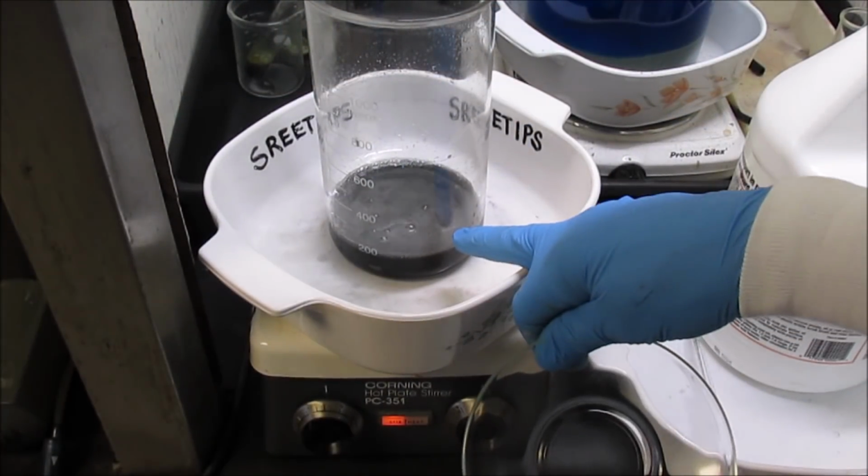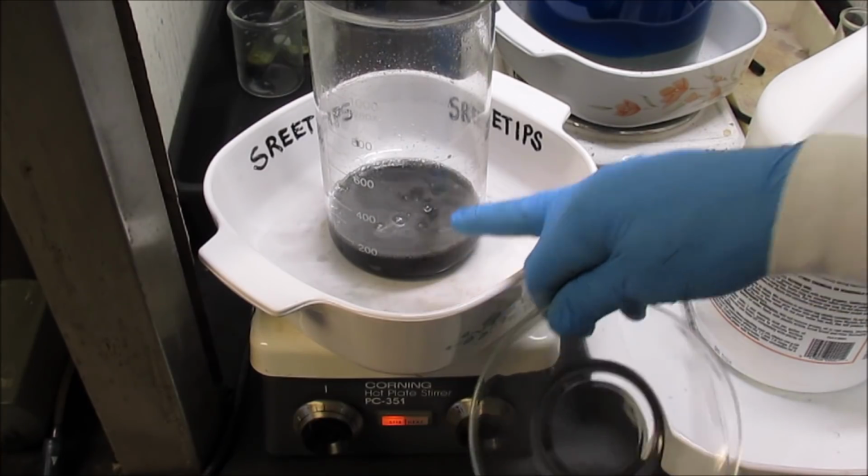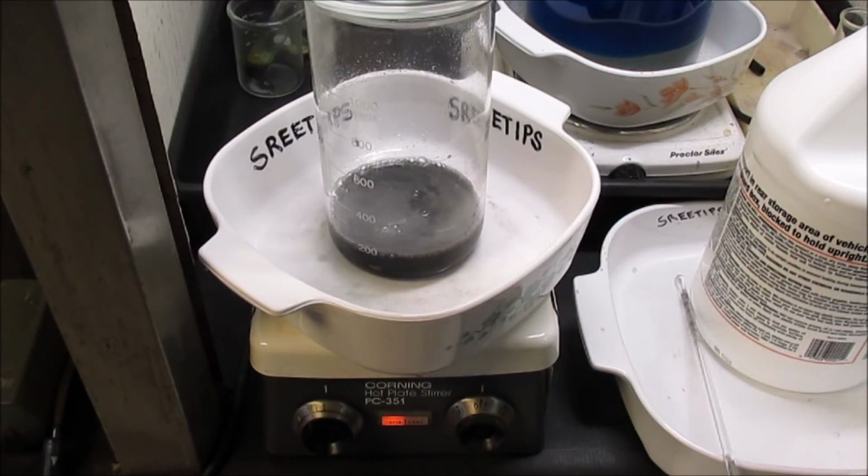The zinc is reacting with the hydrochloric acid that I added, and I want to get that out of there first before I go to the hot hydrochloric acid boil. So I don't have any heat on right now, just the stir bar to get the zinc out of there.